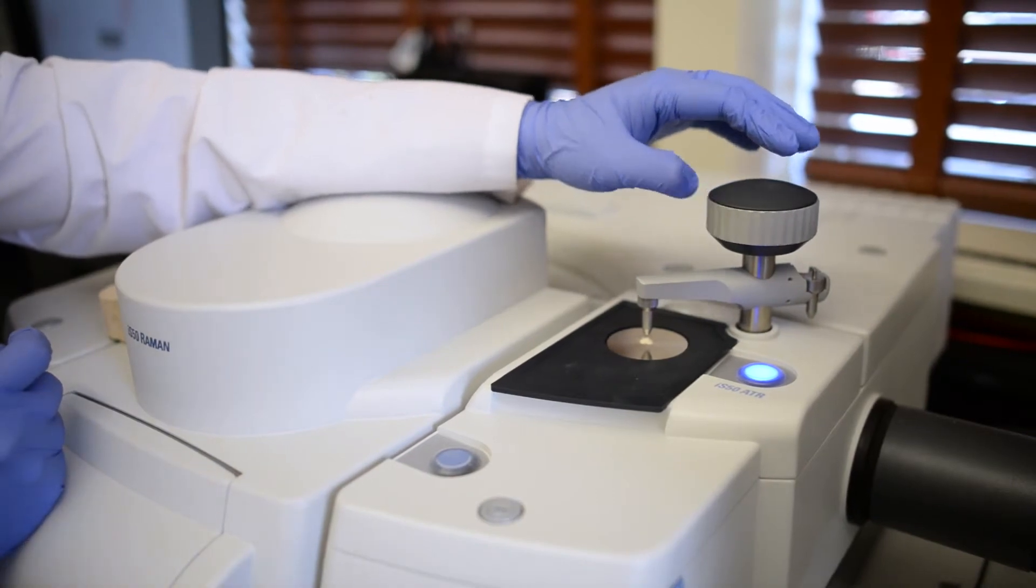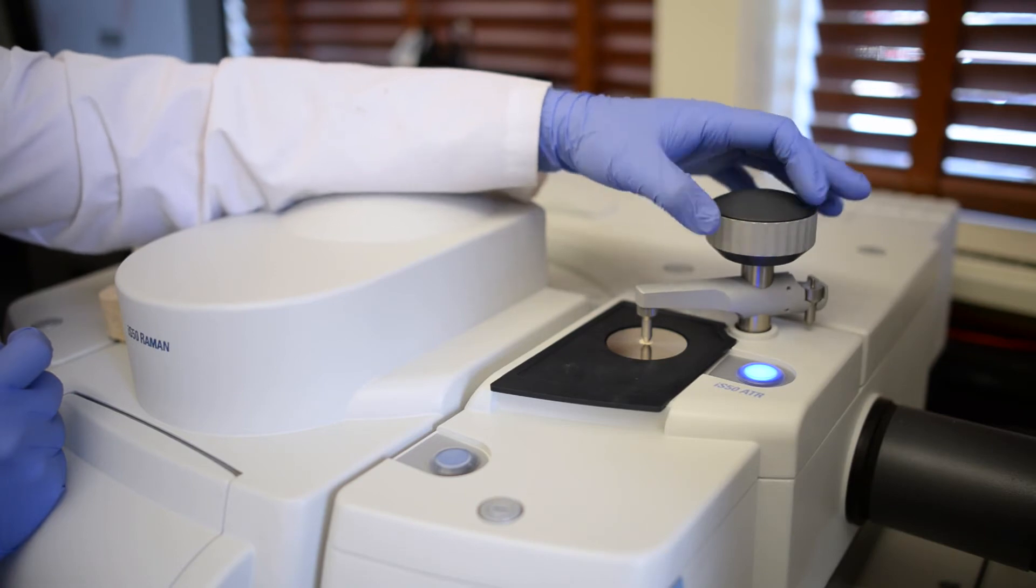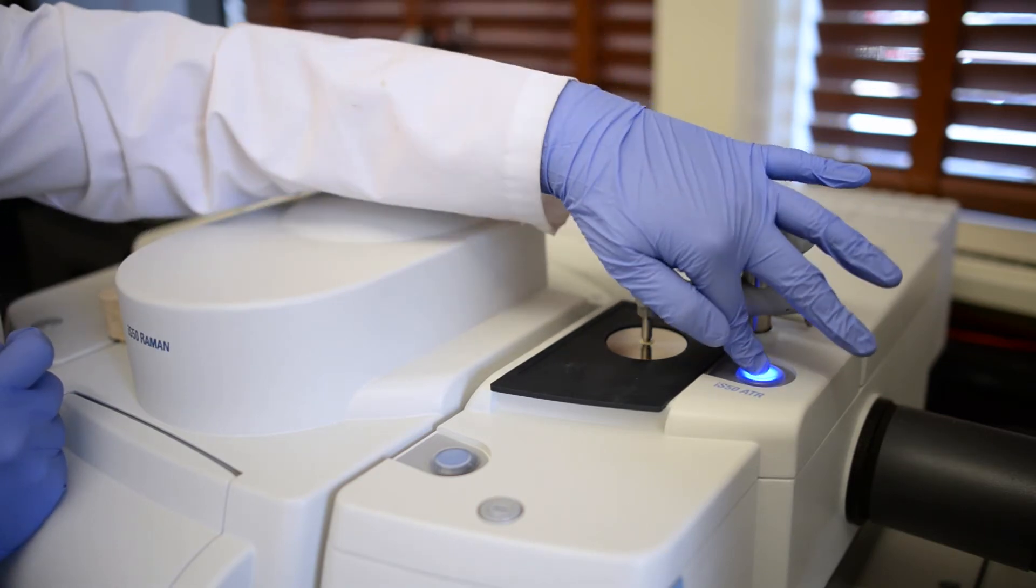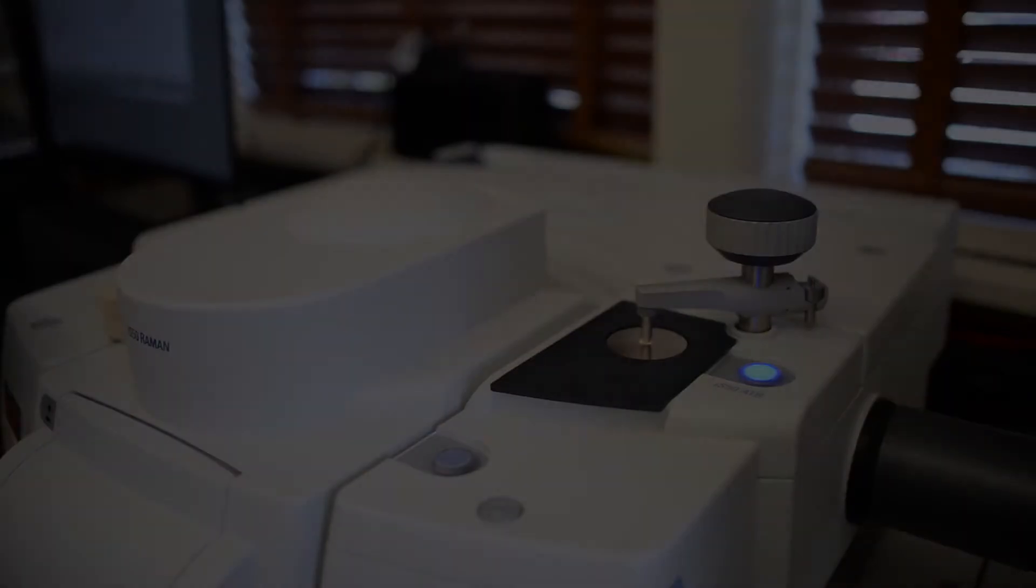Close this handle right here. So basically, we're now ready to take the IR spec. That ensures that we have contact of the powder with the crystal itself. And I press that button there so we can run and get the spectrum, which you'll be seeing on the computer later.